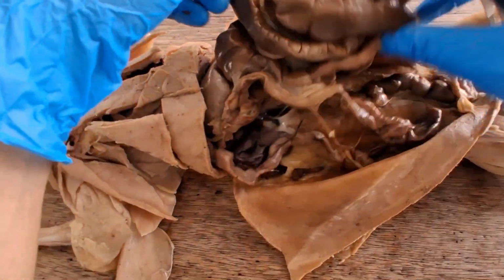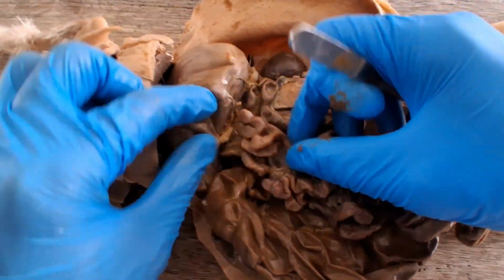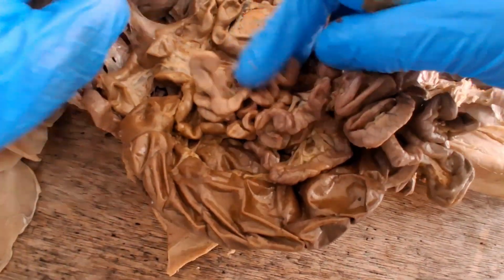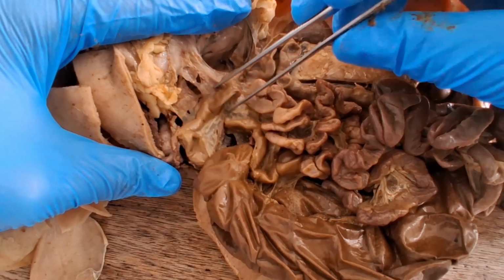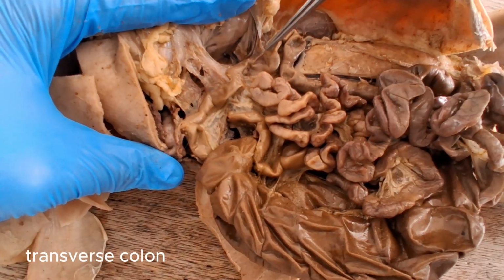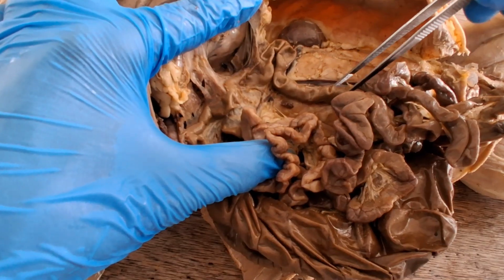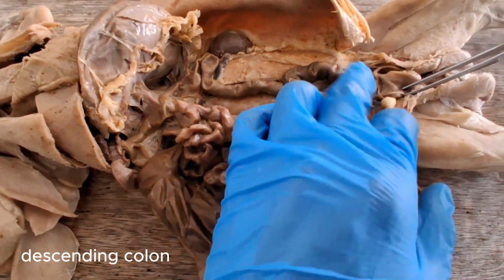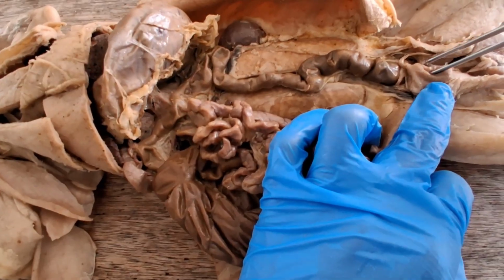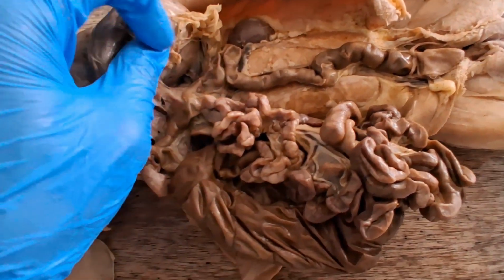Ascending colon. From the ascending colon, food passes through the transverse colon and then to the descending colon. Descending colon, descending into the pelvic cavity. Once inside the pelvic cavity, it's now called the rectum. And then feces go down to the anus.